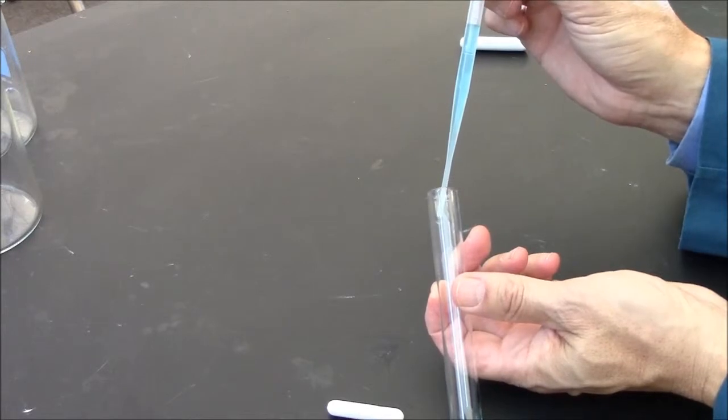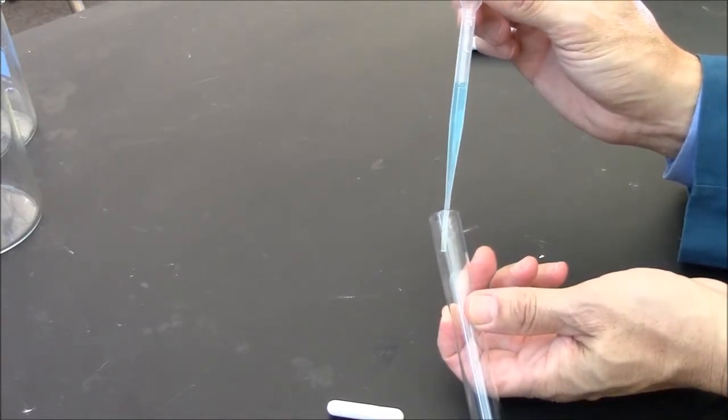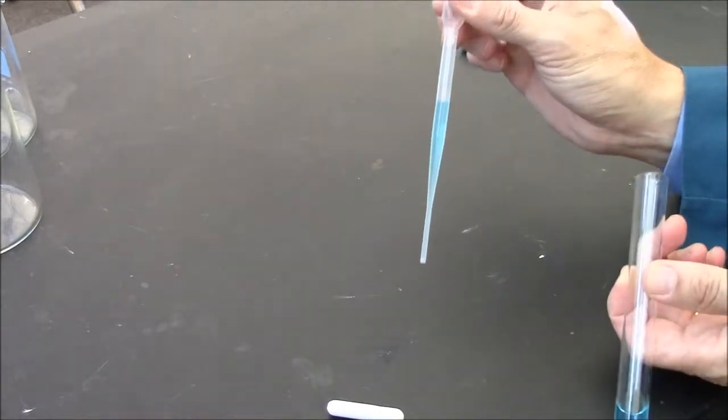And then I'll just drip, drip, drip until I get to the one milliliter mark right on the line.